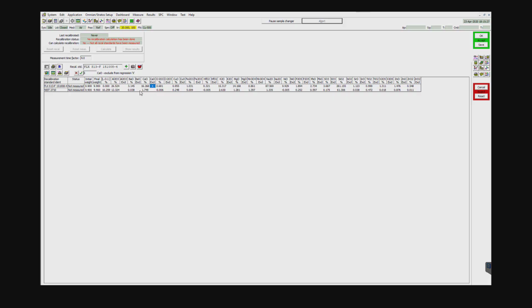And you can, alternatively, you can also go in here and say, well, you know what, look, this sample has no hafnium oxide, so I'm going to go ahead and get rid of it. I'm not going to use it. So you can go ahead and go through there and you can hit X and get rid of things that you don't want. So I'm going to go ahead and delete that because I only want the 1 sample.